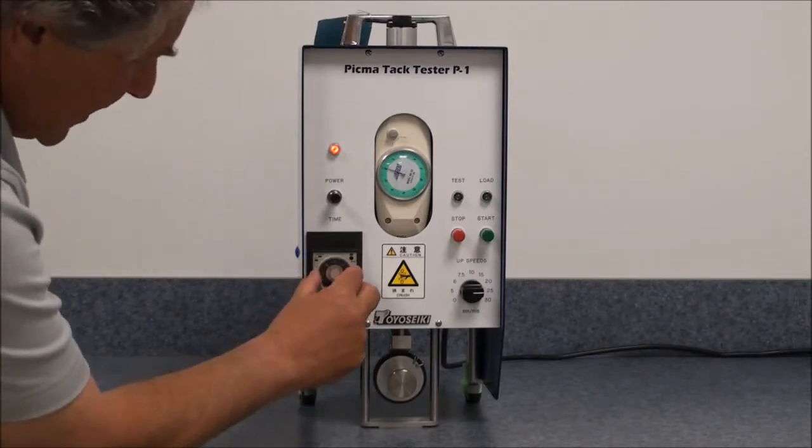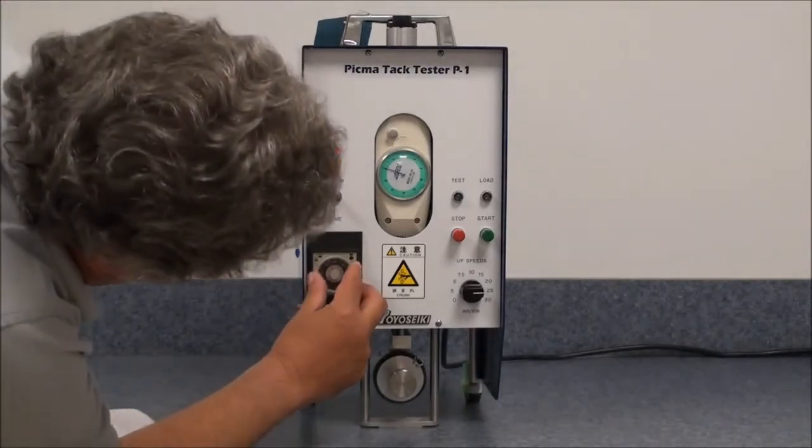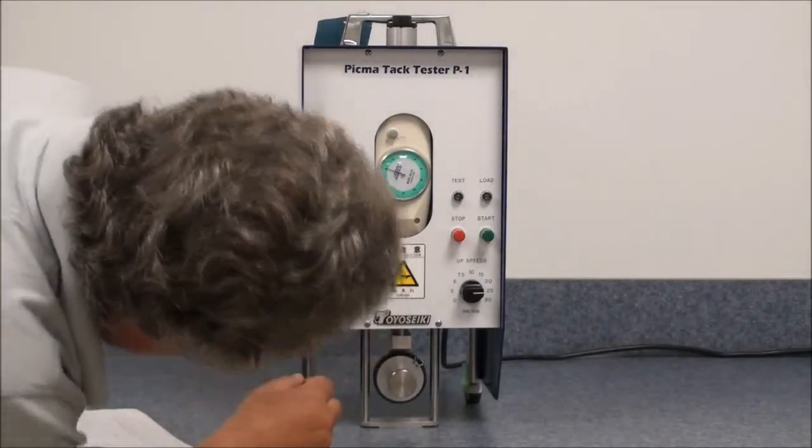We will set the contact time, or dwell time, to 10 seconds.